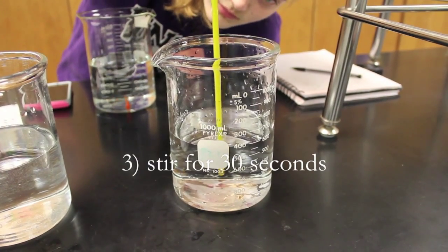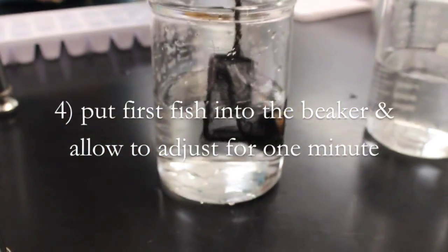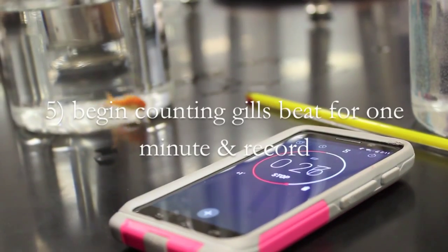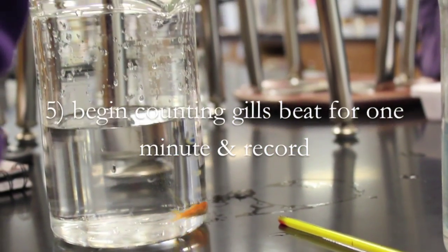Pour 600 milliliters of water with a room temperature of 18.3 degrees Celsius in the control beaker that is labeled with the number 1. Stir for 30 seconds to ensure temperature consistency. Put the first fish in the beaker and allow it to adjust to the temperature for 1 minute. After 1 minute, begin counting the number of breaths the fish takes by counting and recording the number of times its gills beat for 1 minute.